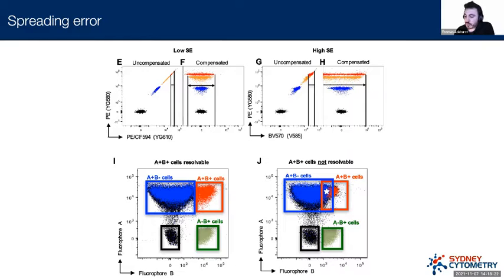In this case, what we wouldn't be able to do is see how many T cells have become activated, because the actual CD3 signal is going to prevent us from doing that. And this is where spreading error becomes a pretty significant problem.